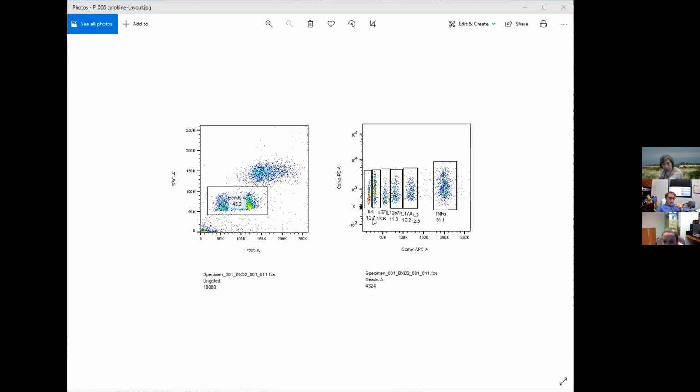Is it the frequency of the parent gate? Well, the question is whether it's the mean intensity. I think it's the mean intensity, right? I would think it's the mean intensity of the PE, not the frequencies. Right, it looks like it. That's why I asked.